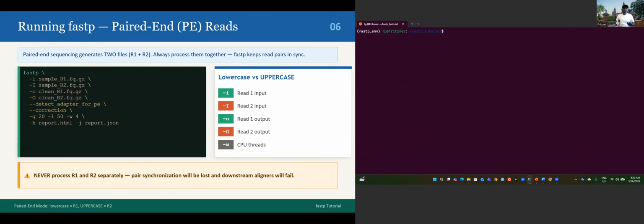For the paired end, we need input one, input two, output one, output two. This is just the difference, but the scope is basically the same. Let's go: fastp, dash i, let's call it sample_R1.fastq.gz, dash I. It doesn't matter where you place them, but you need to respect the capital and lowercase.